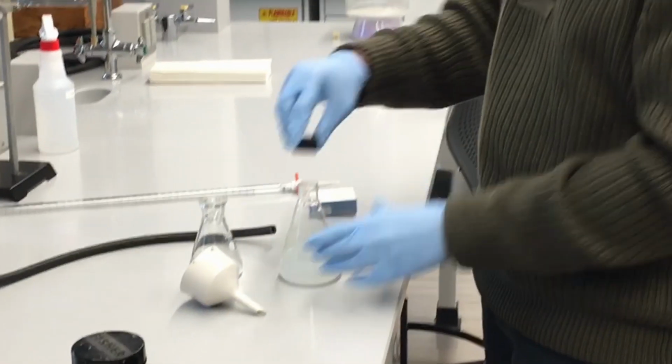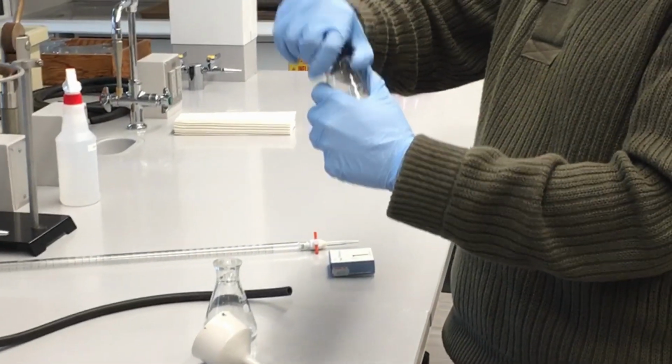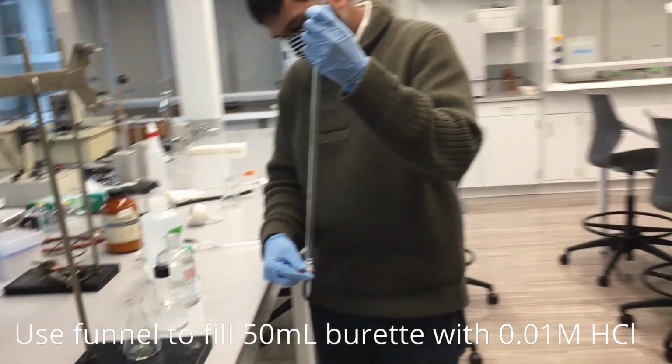Now we don't want that to happen. So as soon as we're done, we're going to go ahead and place it into this Erlenmeyer flask and seal it, cap it. That way the extra carbon dioxide in the atmosphere cannot react with it.